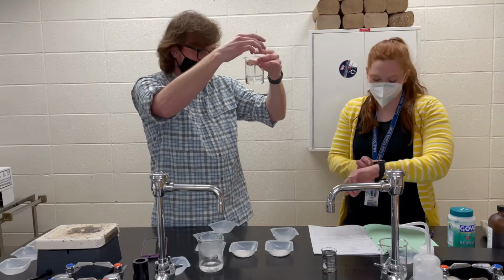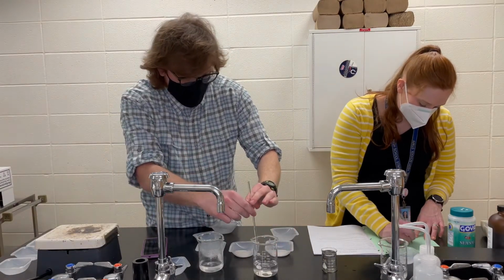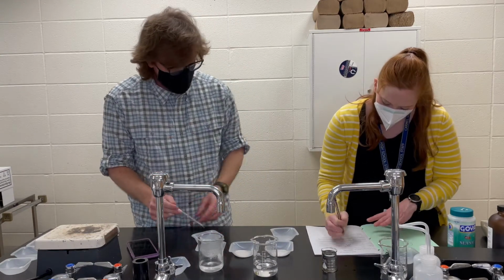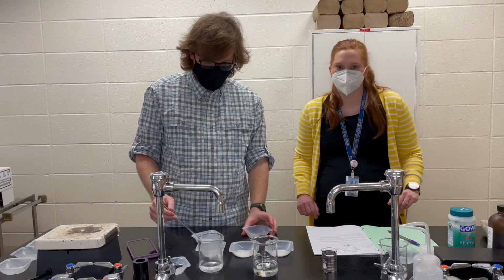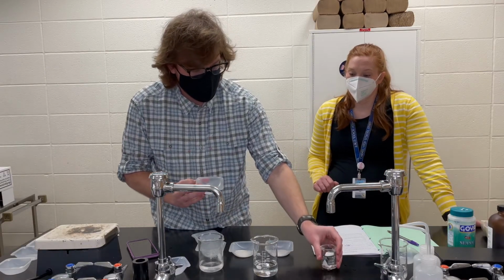That's looking pretty much done. Boom, 147 seconds. At this point, hopefully you are recognizing some sort of trend, but we are going to go ahead and do our cold water.